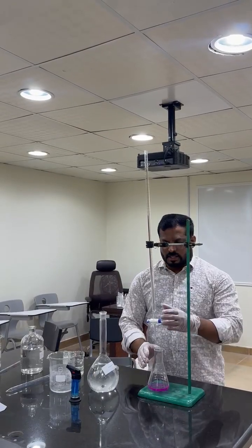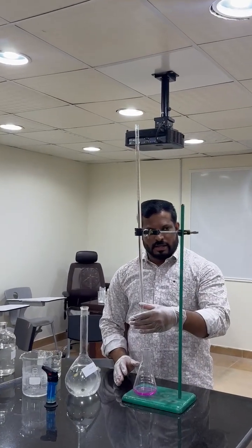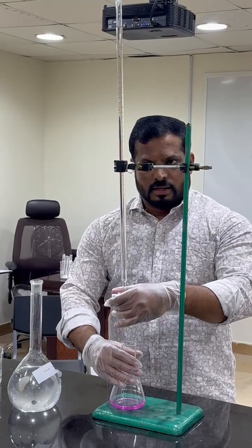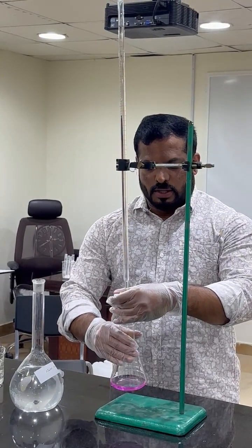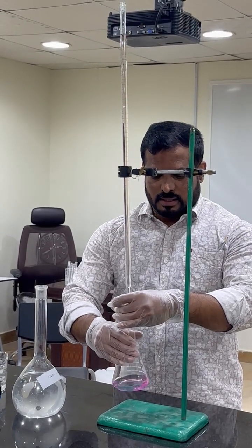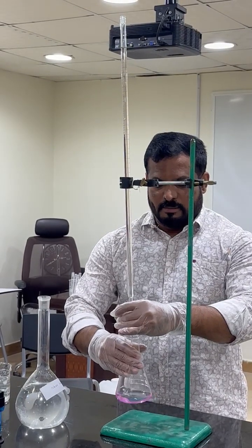We are going to do the titration. Look how I am just going to hold — your left hand will be like this way. Right hand hold it. Slowly open and constant swirling. In one drop the color will be changed. That will be the end point.